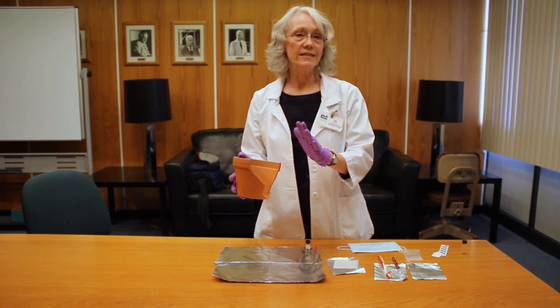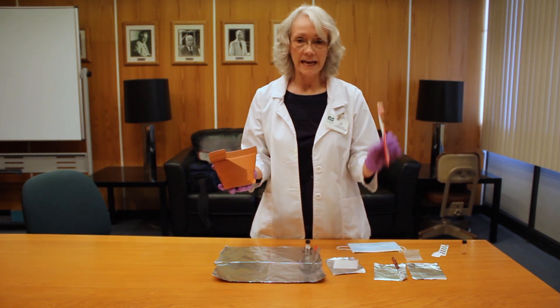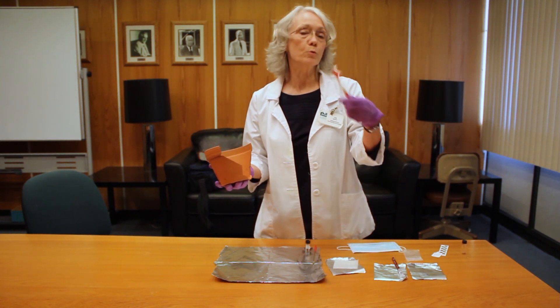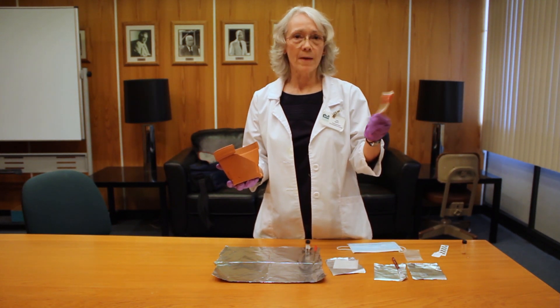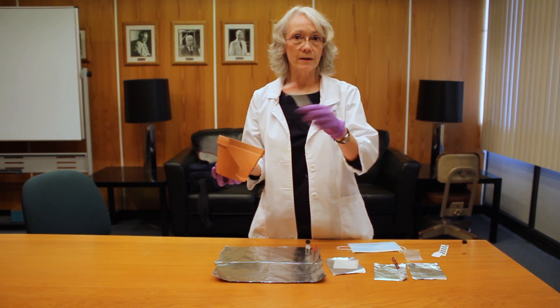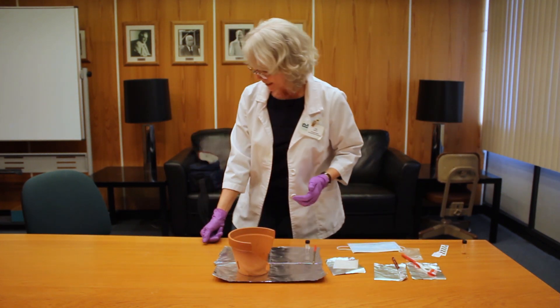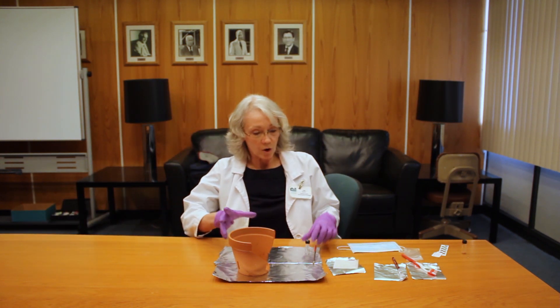When you're looking at your pot deciding where you're going to sample from, if you notice there's dust on it from having been sitting somewhere, take a new unused toothbrush — maybe sterilized in boiling water or rinsed off with methanol or some kind of solvent — just make sure it's clean. You can give the area you're going to be sampling a quick brush off. When deciding where to sample the pot, you want to think in terms of where you're going to get your best sample and aesthetics.